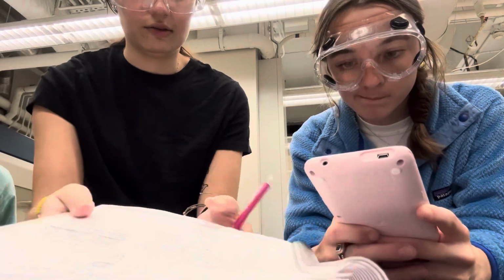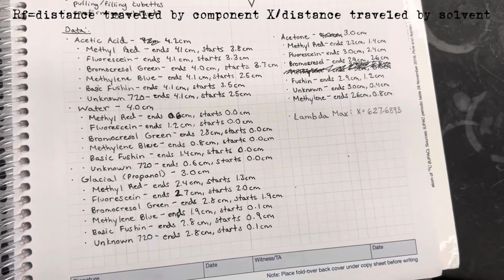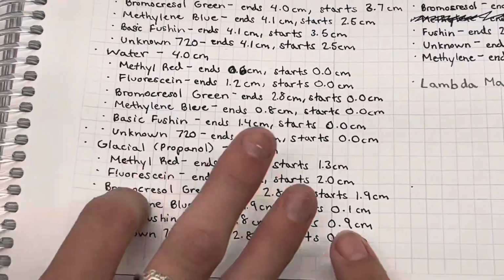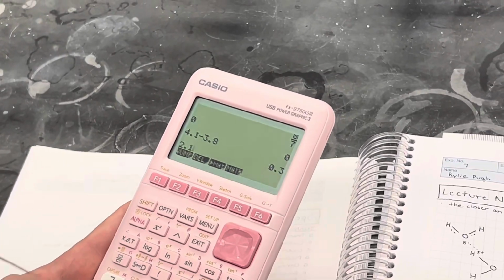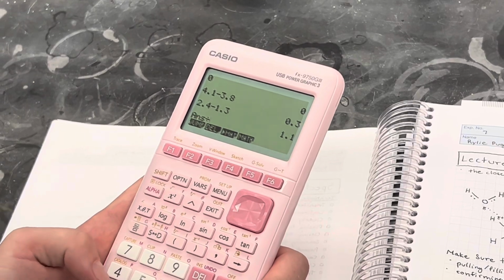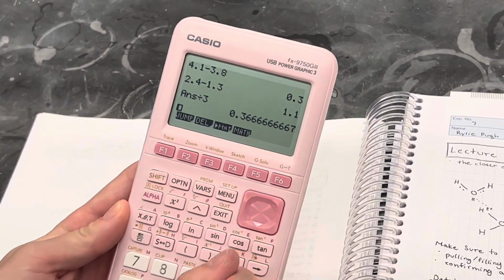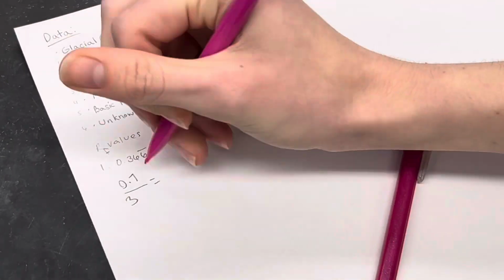So the Rf value is what we're calculating right now. This is basically the distance traveled by a component over the distance traveled by the solvent. So you're dividing the two, and it is a value without units. This value indicates the preference of the solutes for the stationary or the mobile phase. So that's what we're calculating right now.